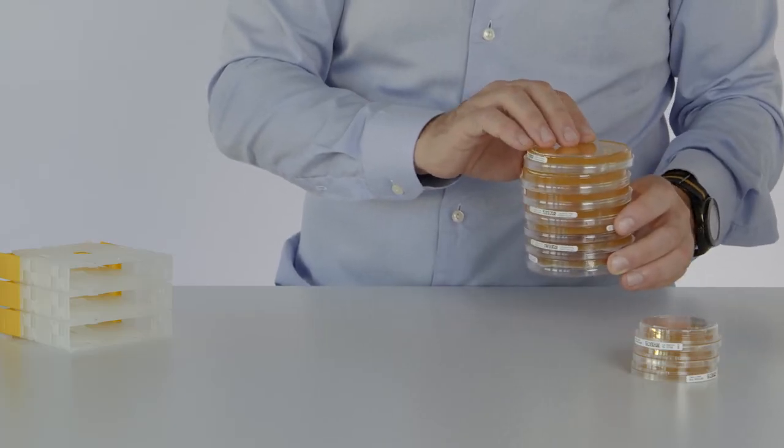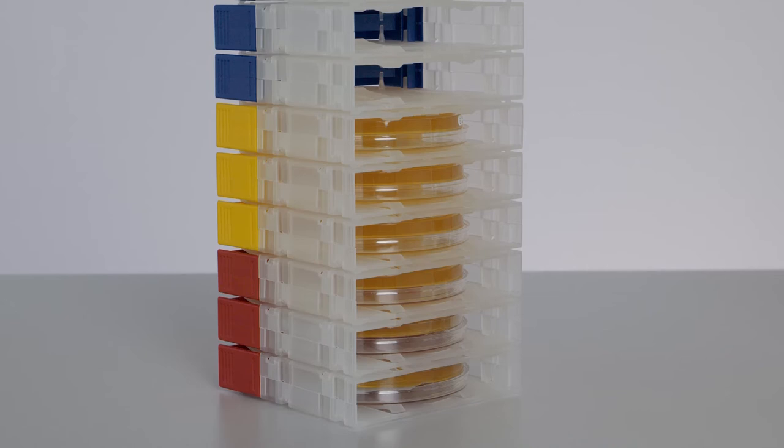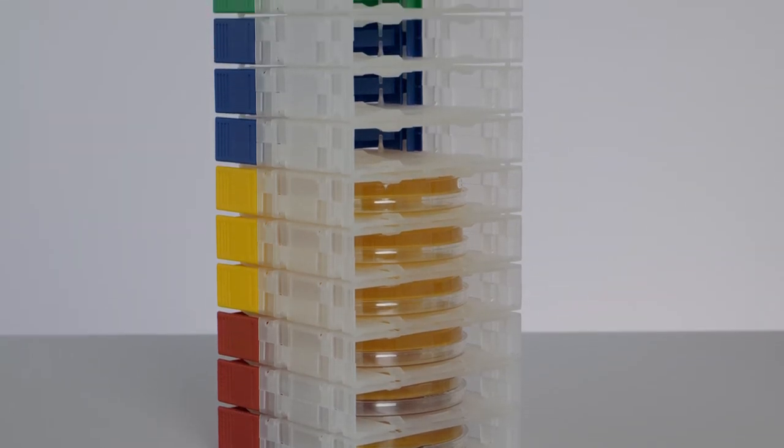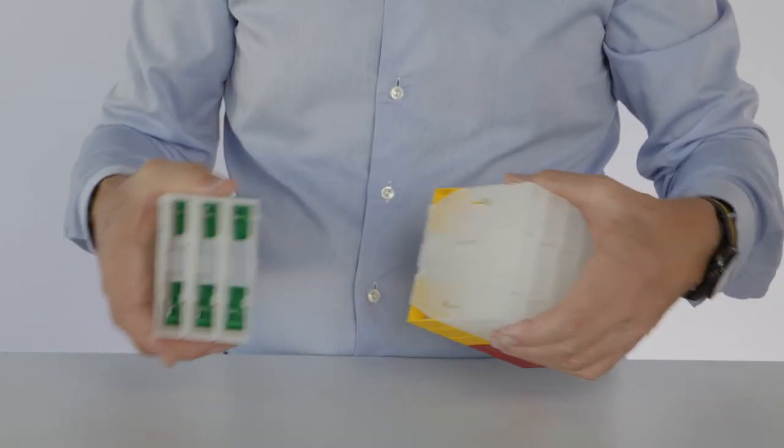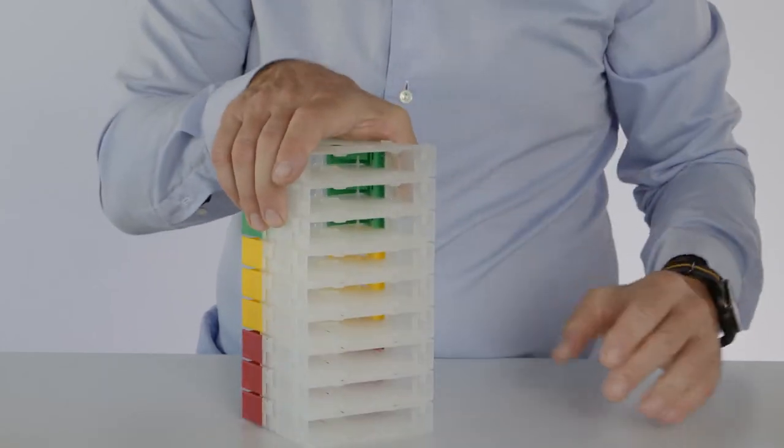Carrying a stack of media plates is a risky task. With PSD, you can stack up to 10 plates safely. And this is how to stack and unstack them.